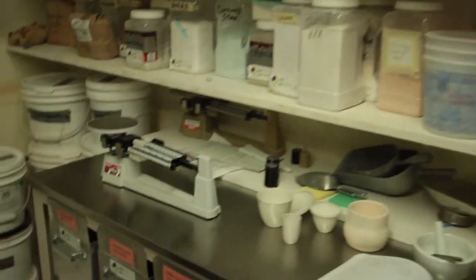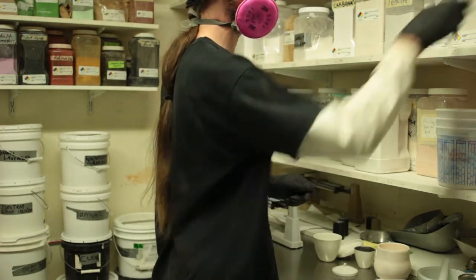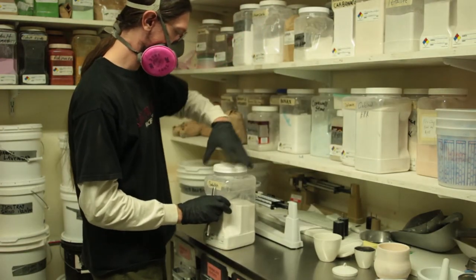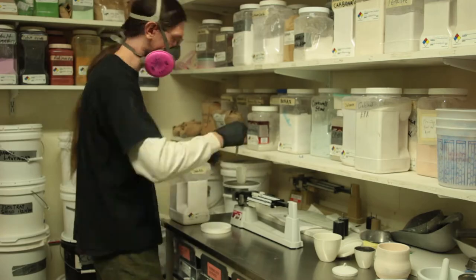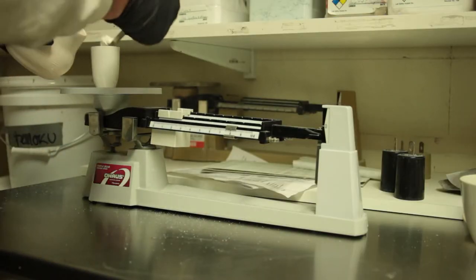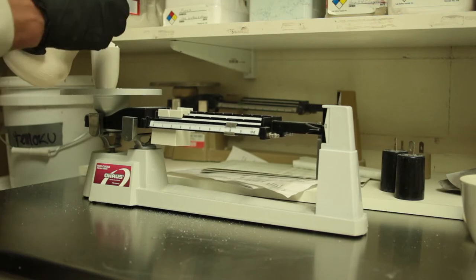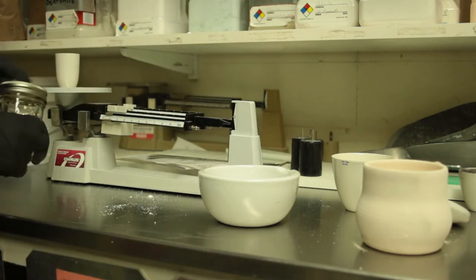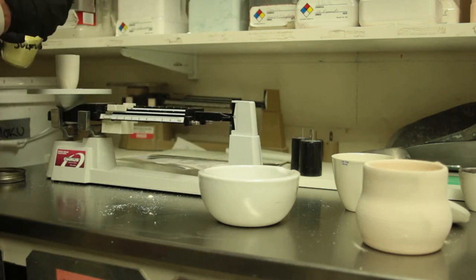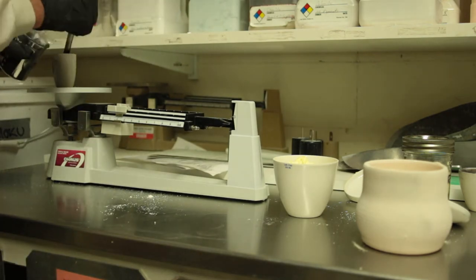Starting out here, I'm weighing out 18 grams of sodium carbonate — in this run I'm using soda ash from the ceramics lab, though in other runs I used anhydrous sodium carbonate from the chemistry department. Then 18 grams of freshly calcined EPK as the source of silica and alumina, 10.8 grams of sulfur from a garden supply center used unpurified, and 2.3 grams of activated carbon provided by the chemistry department.